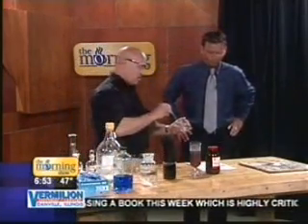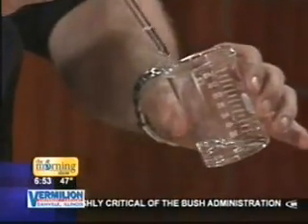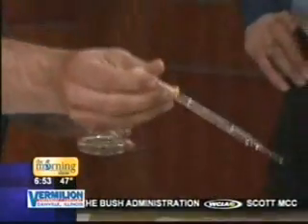Okay, so I'm just going to add a little bit of sulfuric acid, and this is going to be very bright and smoky. So we'll get a zoom in on it whenever it happens. All right, here we go. Oh. And there you go. Just like we're basically making our own fireworks this morning. That's right. And that is a component of a lot of fireworks: potassium chlorate and some sort of fuel. In this case, it's sugar.